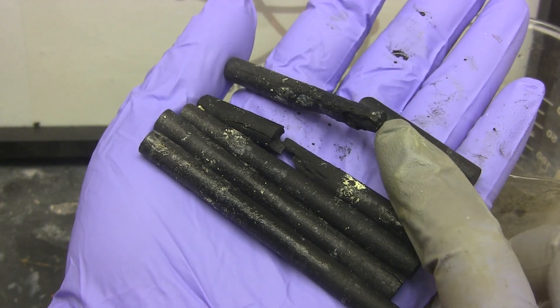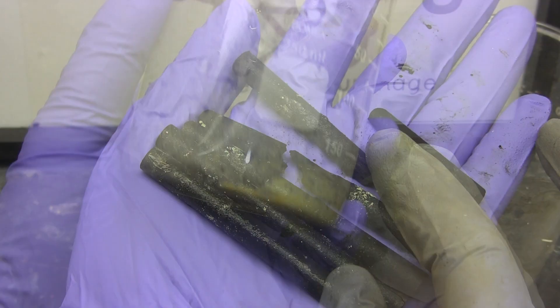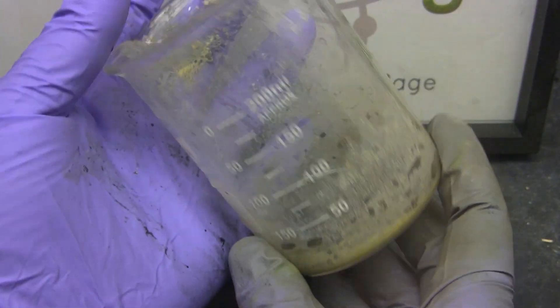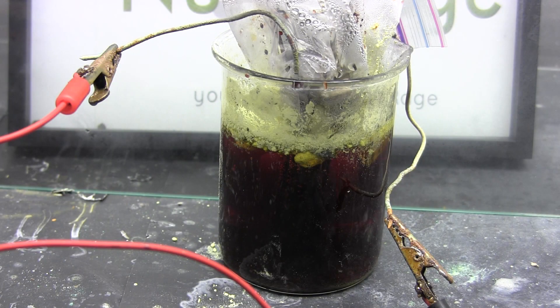And I don't want to use pure platinum yet since it's expensive. The process also covers a lot of the apparatus with sulfur which is a pain to remove. I also need to devise a better container as some of the bromine inevitably evaporates from the open beaker.